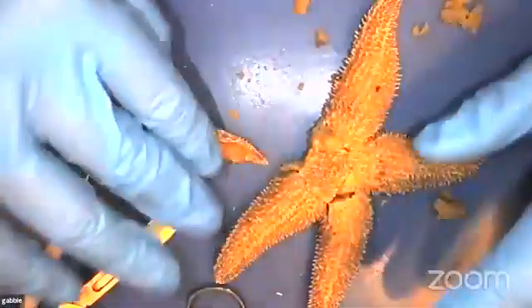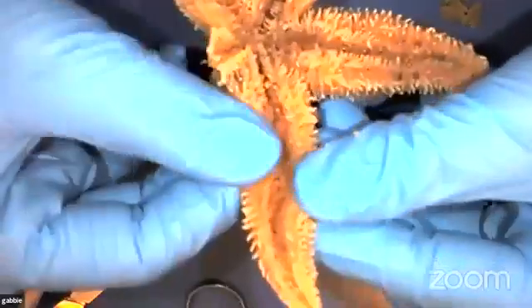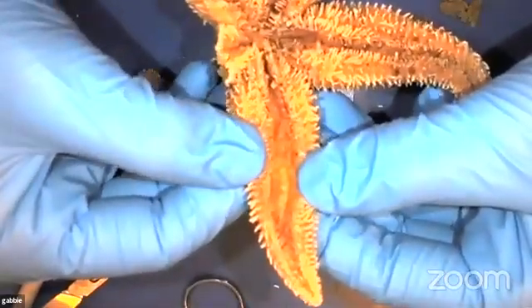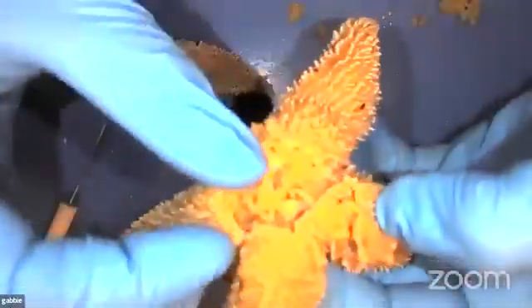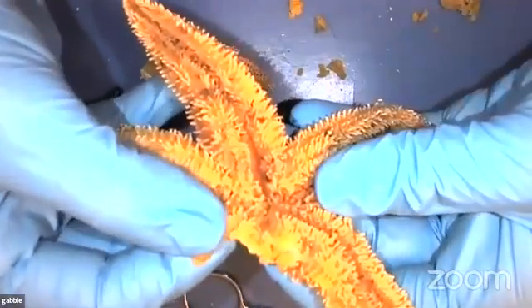So the sea star, even though it's pretty simple, has some really awesome features that you only find in echinoderms like this. We learned about their finger-like appendages, their really unique way of climbing and exploring the ocean. Most of the time they're found in the bottom of the sea. They like to crawl along the rocks and everything like that. And it still blows my mind that they shoot their stomach out to consume their prey.